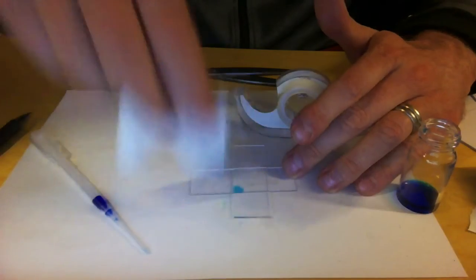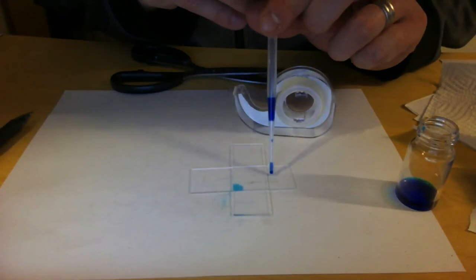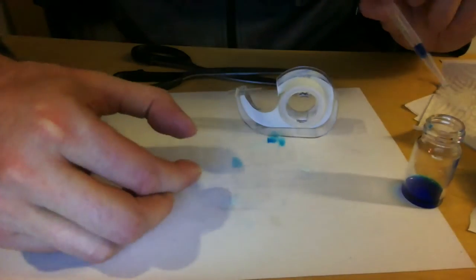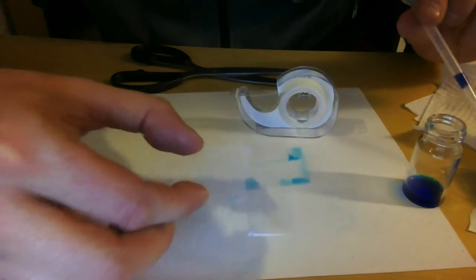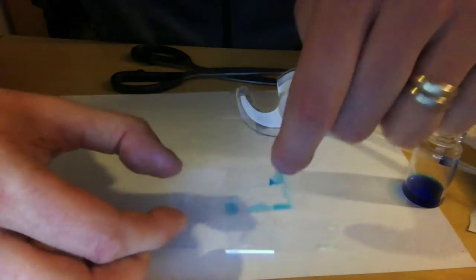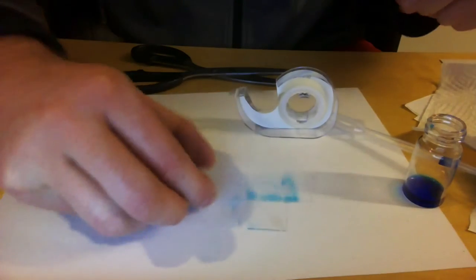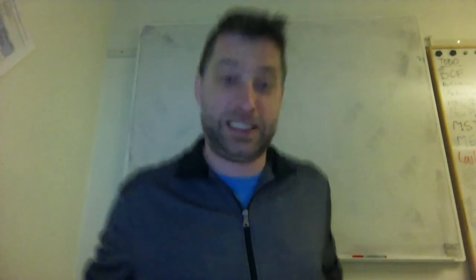So we're going to get rid of this liquid. See what happens if I put liquid here on this side. Maybe this works better. Yeah, actually now you could nicely see it. I hope you guys could see that also. Let's see. Yeah, you can kind of see the bluish channel from here all the way here. Yeah. So I have made a microfluidic system. Hip hoy.